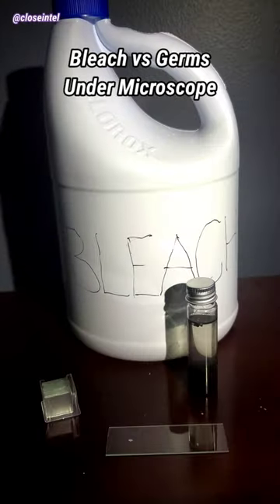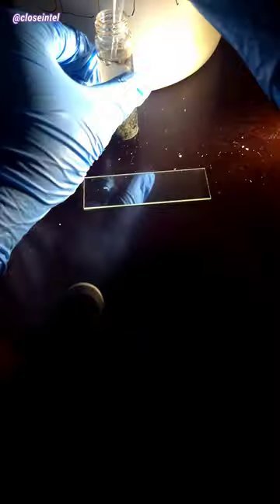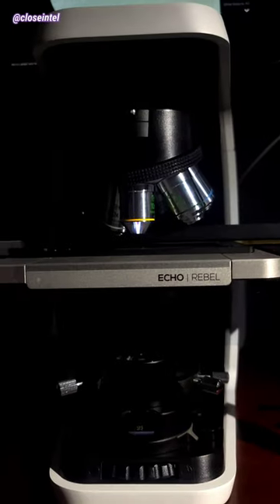Today I'm going to show you bleach versus germs under the microscope. We should get pretty similar results to the chlorine video I did, since they share a lot of the same chemicals just in different concentrations.